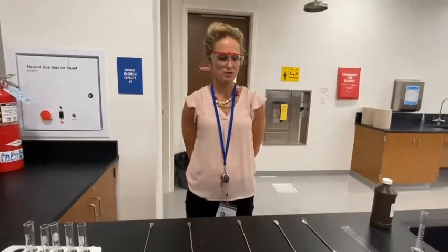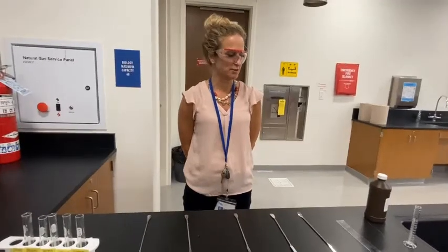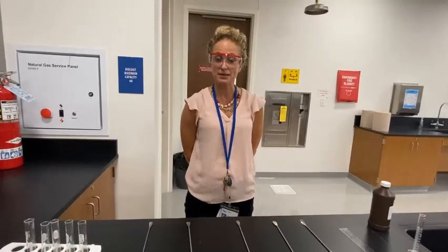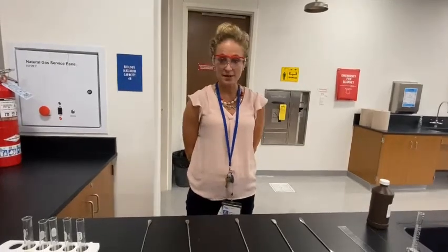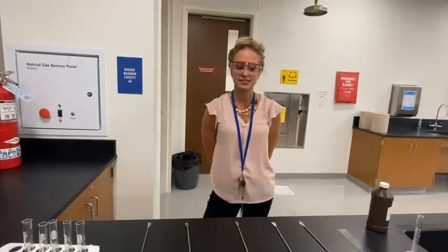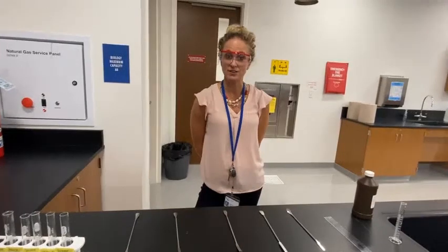Hi there. Today we are going to talk about the function of enzymes. Enzymes are special proteins that speed up chemical reactions by lowering the activation energy. The enzyme that we're going to talk about today is catalase, and catalase is found in all living things.